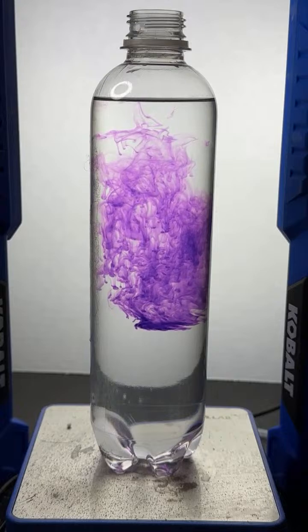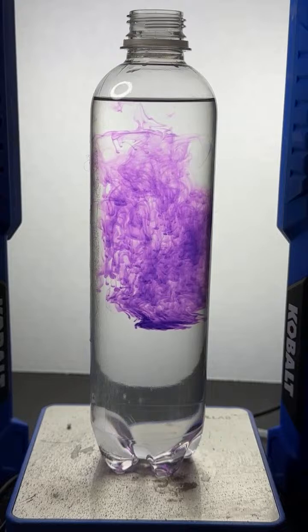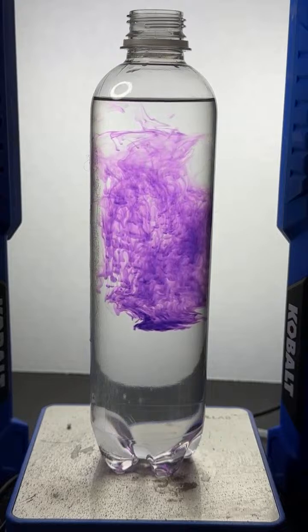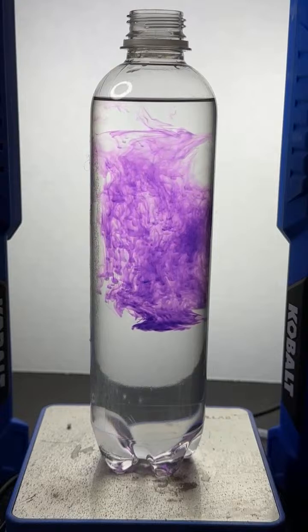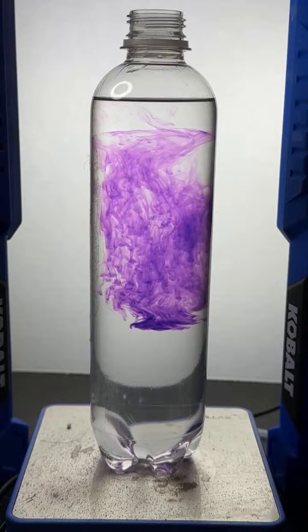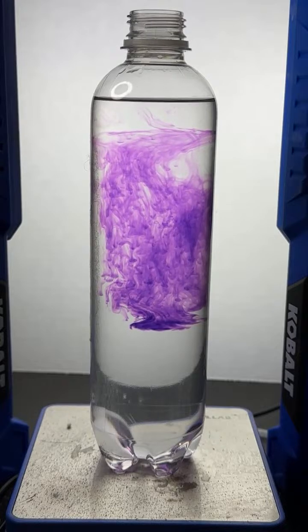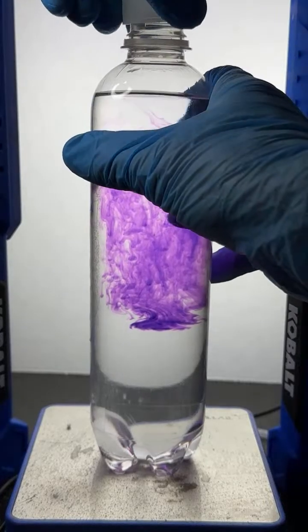Where's the cap? Where's my cap? Curses. Where'd I stick my cap? I need a cap for this. Dadgummit. Well, where's the other bottle? That'll work. Let's just use the other lid. Sorry, y'all. I can't seem to find what I'm looking for here. Here it is. Oh, it's right over here on my left. Okay. All right, here we go. We're going to add the lid to this.